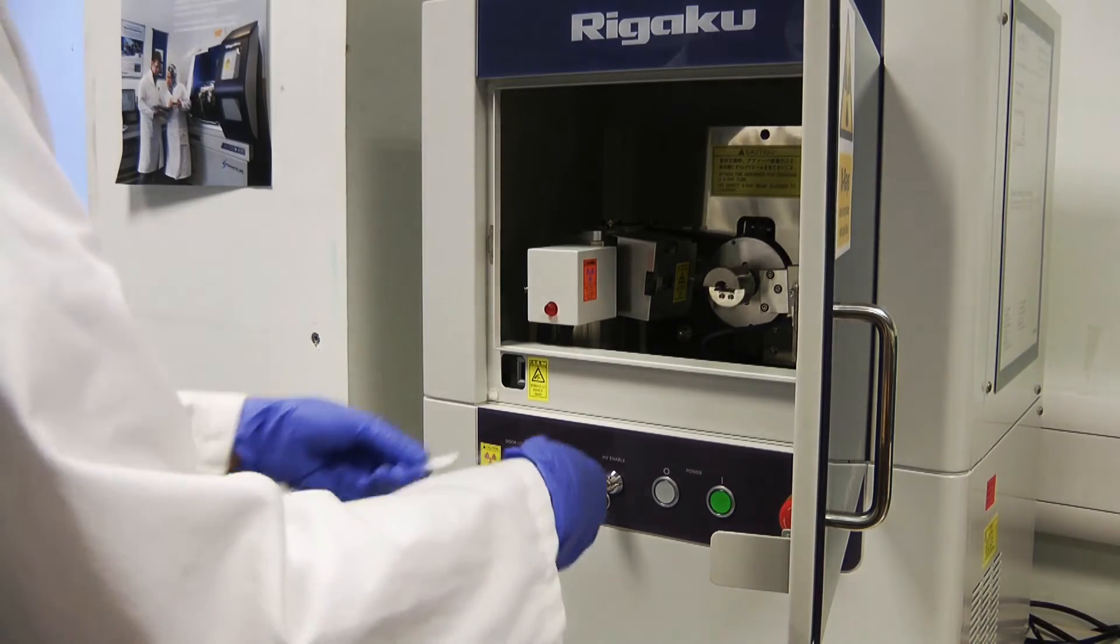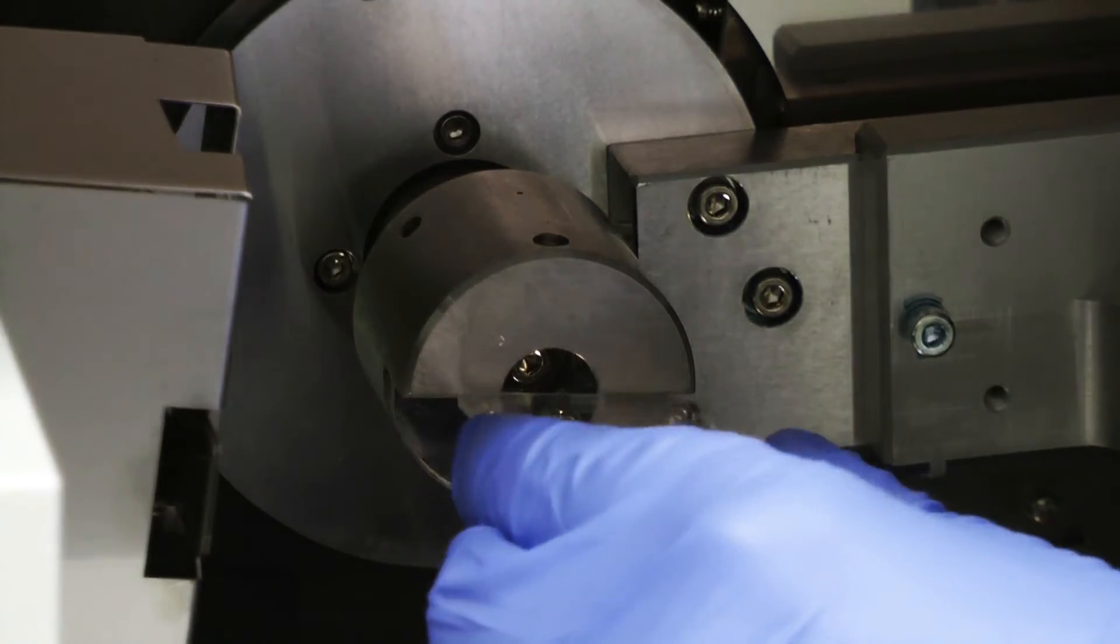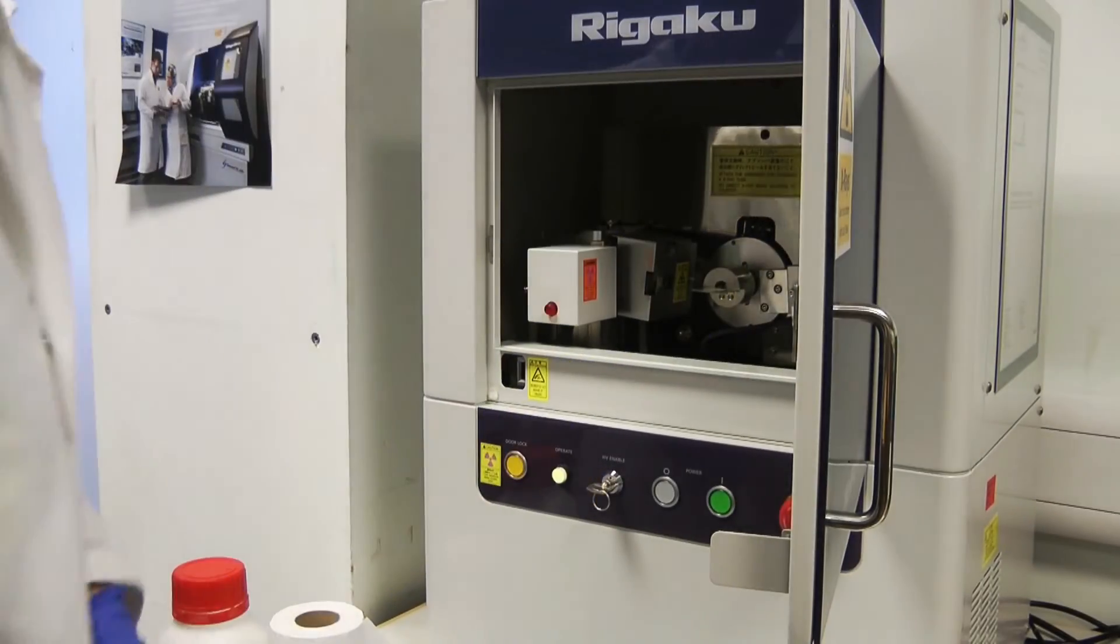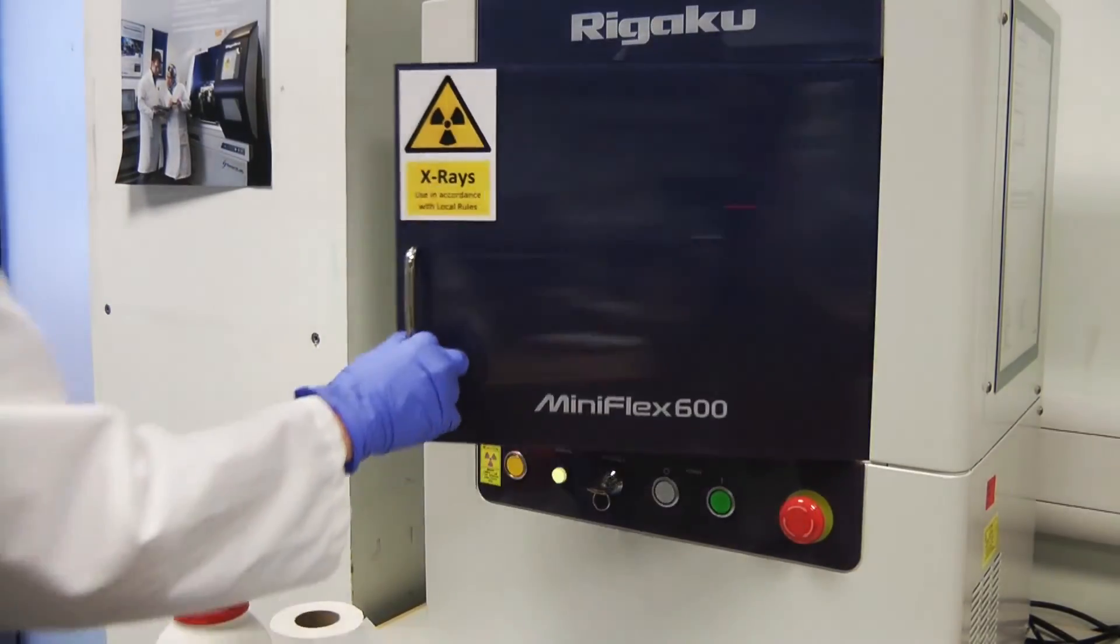Once your sample is prepared, open the door and slide the sample into clips to hold it in place. Lock the door once the sample is in place, and the beeping will stop.